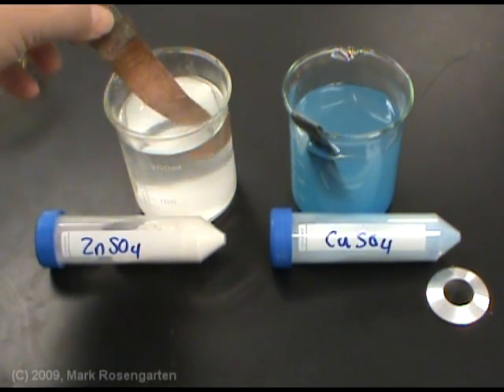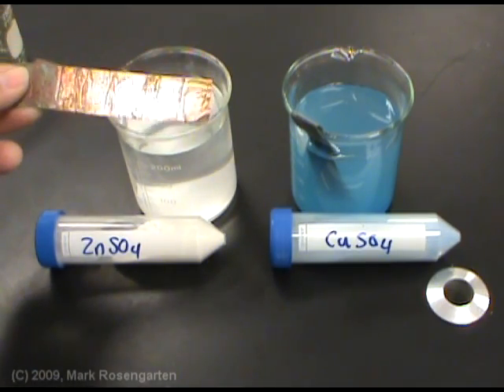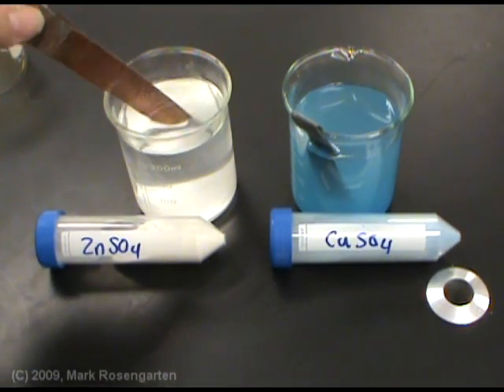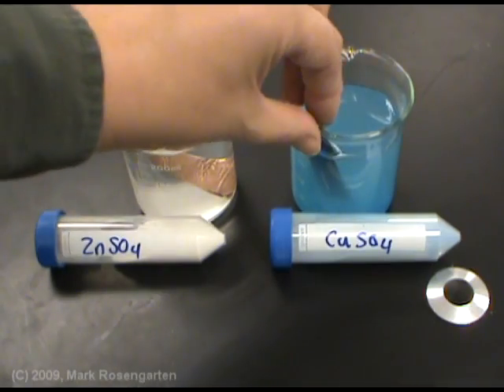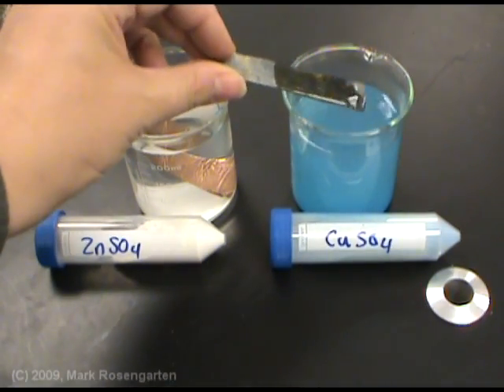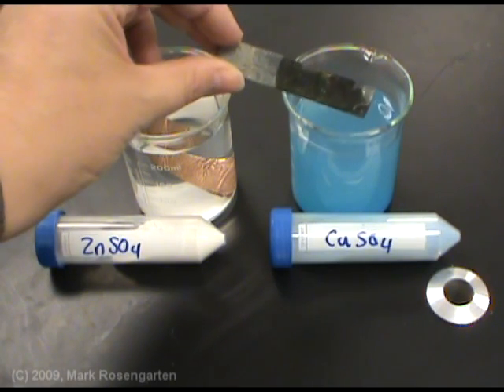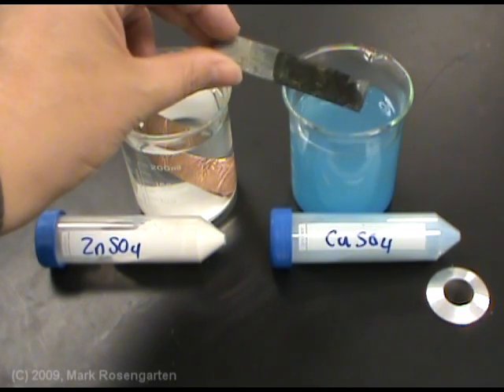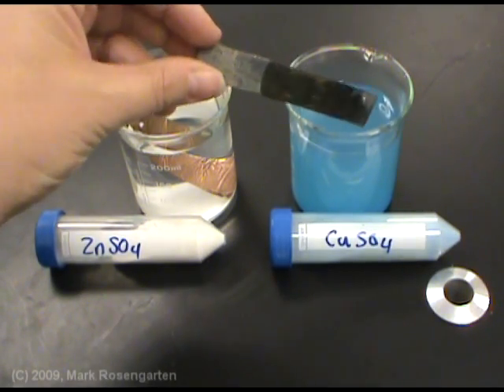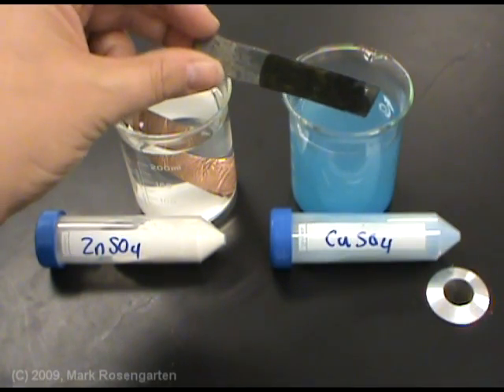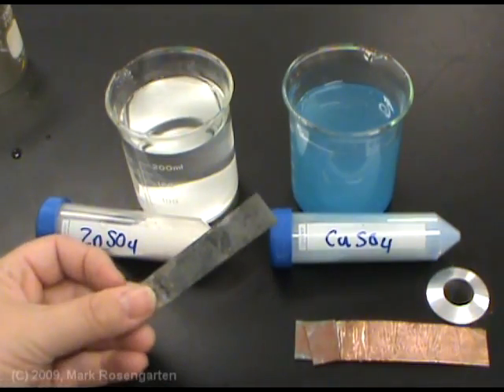After a very short time, it seems apparent that the copper has no reactivity in the zinc solution, but that the zinc has reacted with the copper. The black you see there are microscopic crystals of copper. Some larger crystals have formed up here, giving it a copper color.